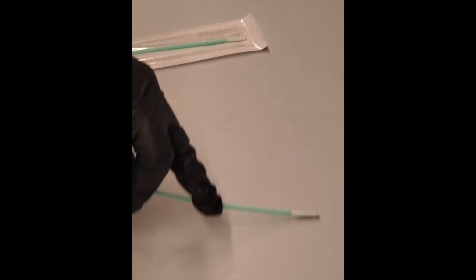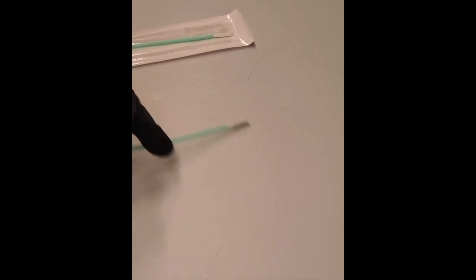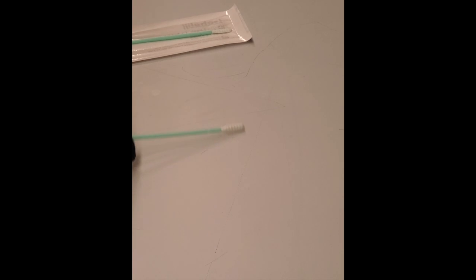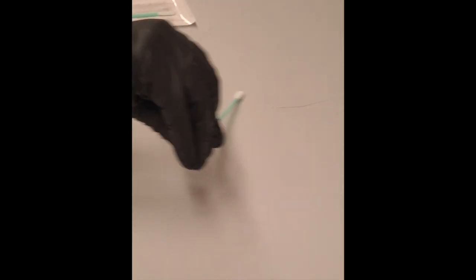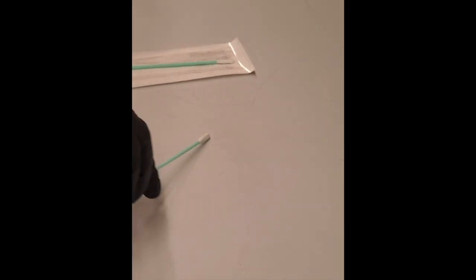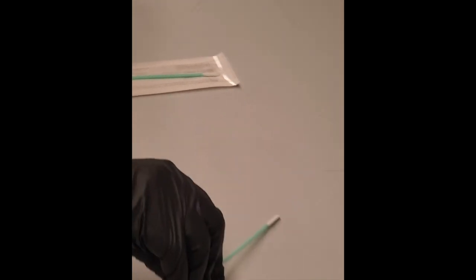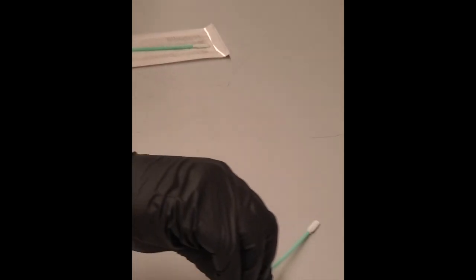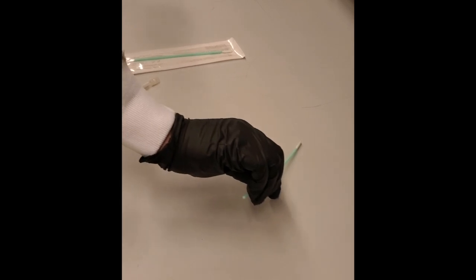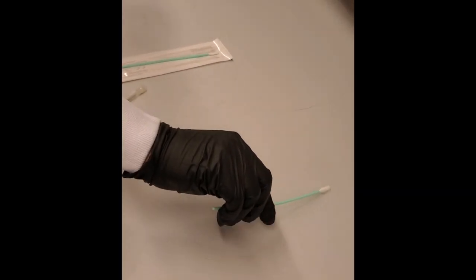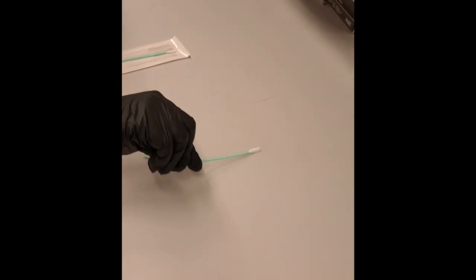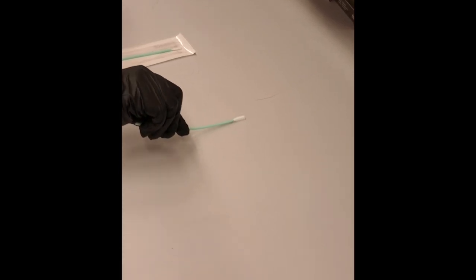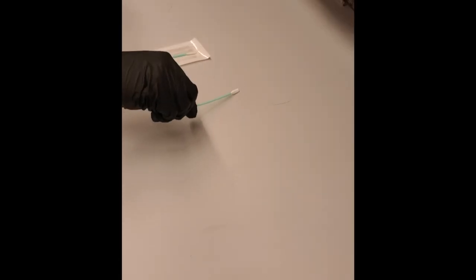Use the swab and swab across, diagonally, and back and forth until you cover the entire area. You're going to want to twist gently as you do this. Don't press down too hard or you may snap the swab.